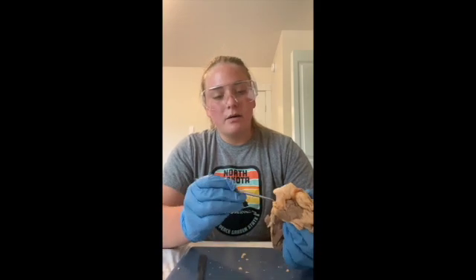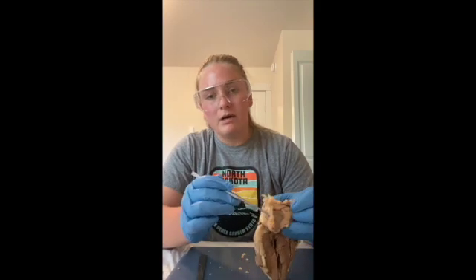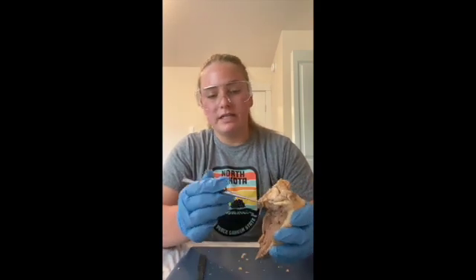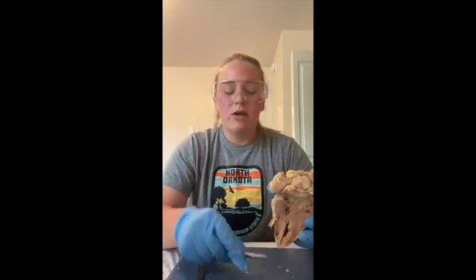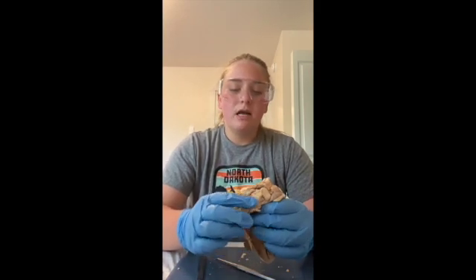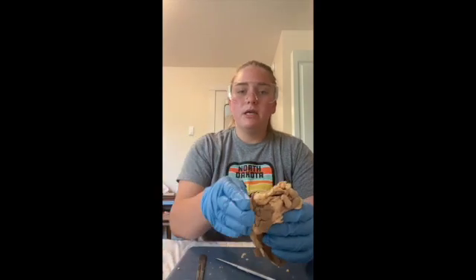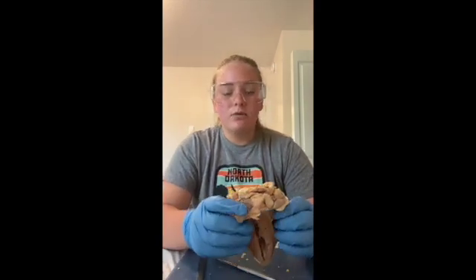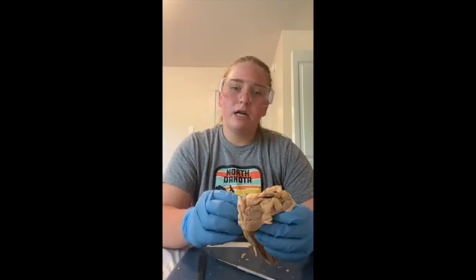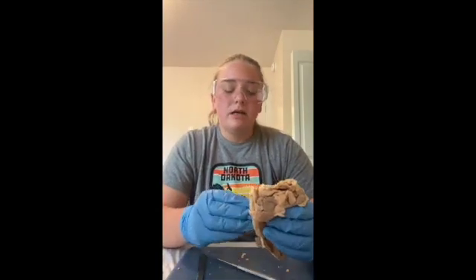They are pouch-like extensions. I kind of cut them off from previously dissecting this, but they will expand when blood is in the atriums. And then next we'll talk about the brachiocephalic trunk. So that would be up here. And this supplies oxygenated blood to the upper region of your body, so that would be like your neck up. Next, we'll talk about the vena cava.